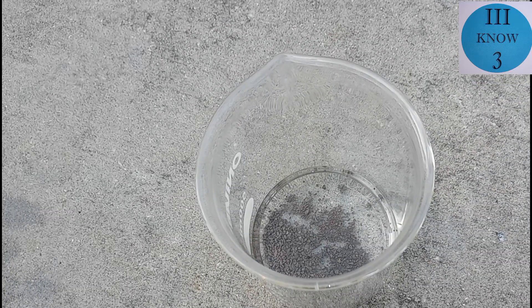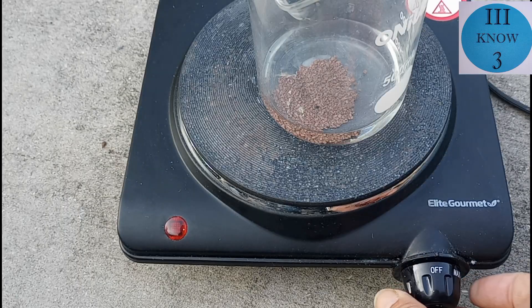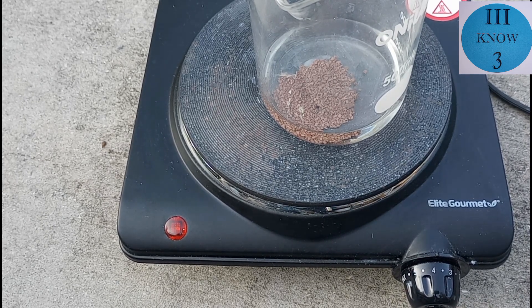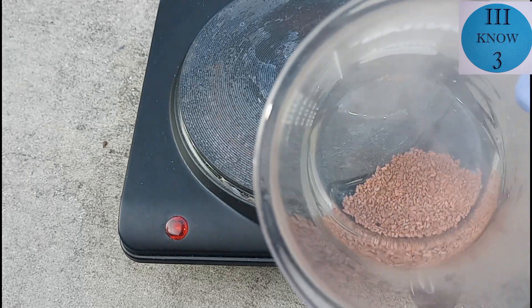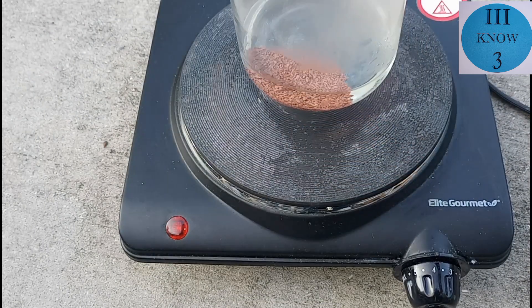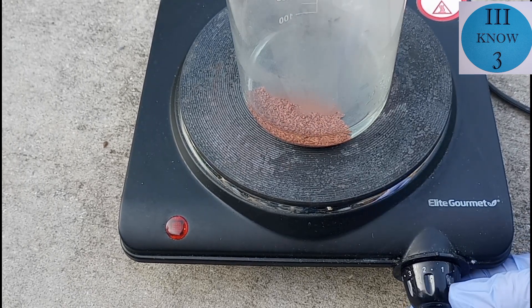There was no immediate reaction, and this is about 15 minutes into it. You could see very few bubbles indicating that anything was being dissolved into the solution. We let it sit for about an hour, then transferred it to the hot plate to see if heat would help anything else get dissolved. After about another hour, really not much had changed — there were no major obvious reactions. The only thing different was the copper was a slightly lighter color, which may indicate that the outside was covered in something that dissolved into the hydrochloric acid, but it just didn't give enough of a visual cue.